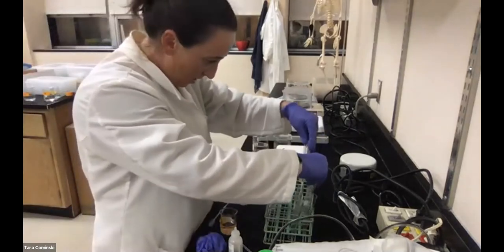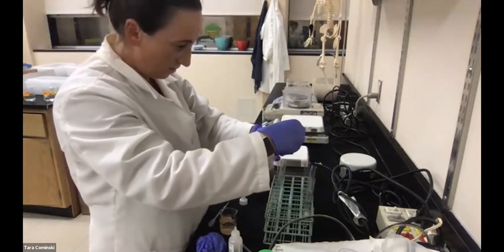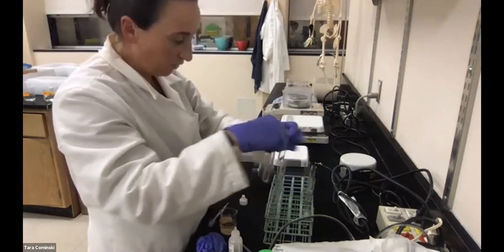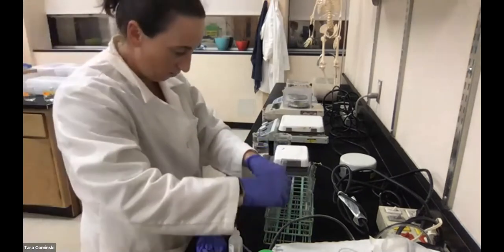I thought I had another set of tubes. No, that's okay. I got 1, 4, and 5, so don't worry, I'll know which ones are which. Let me rinse these out a second. All right, so let's add our catalase.